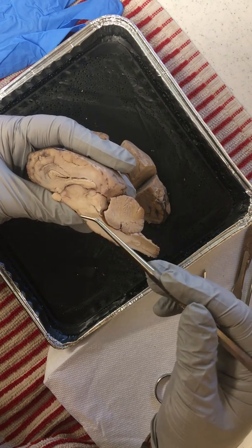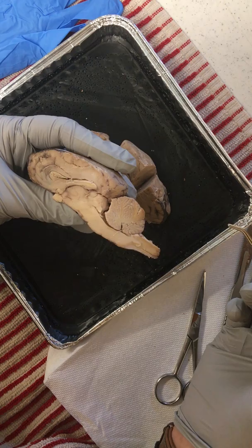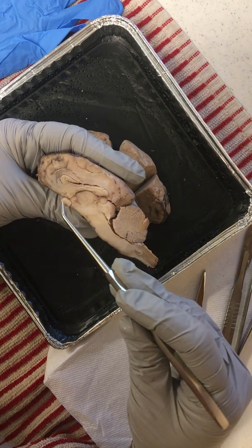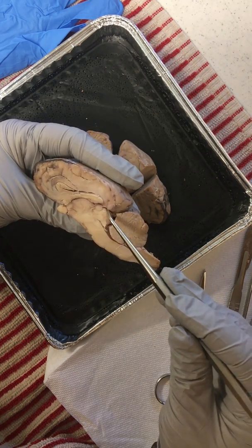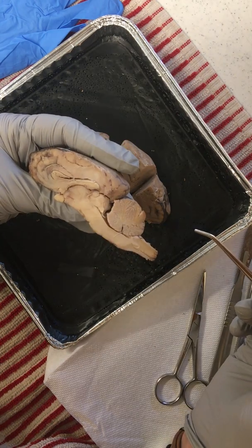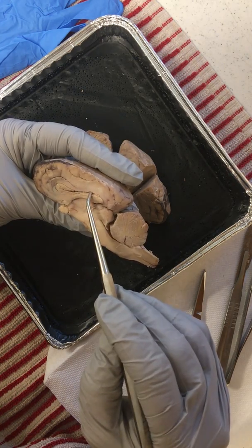And underneath that, we have the hypothalamus. Here in this midbrain is responsible for hearing and visual reflexes, all those sensory type reflexes. Again, here is that optic chiasm, and we have the pituitary gland as well as the pineal body, and those are responsible for a lot of endocrine function. Here's that main wave-like structure, the corpus callosum.